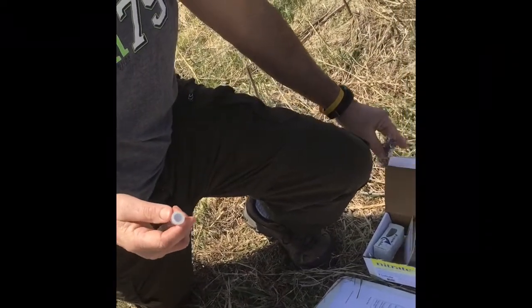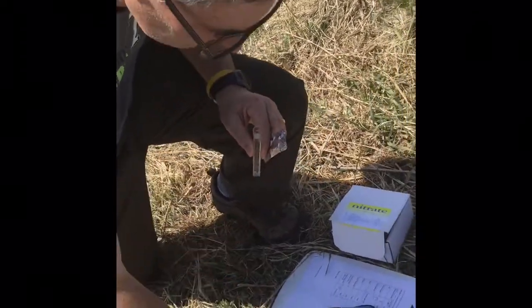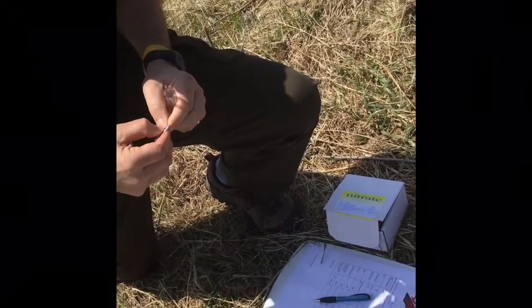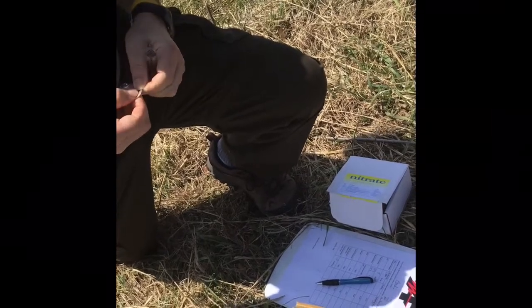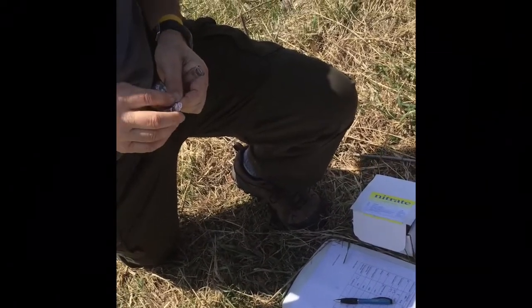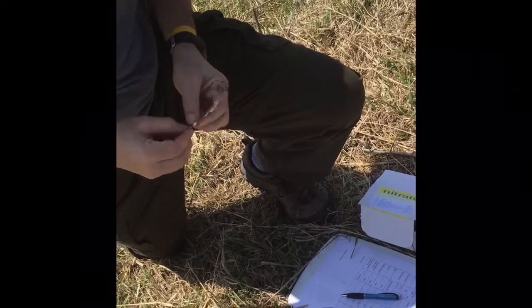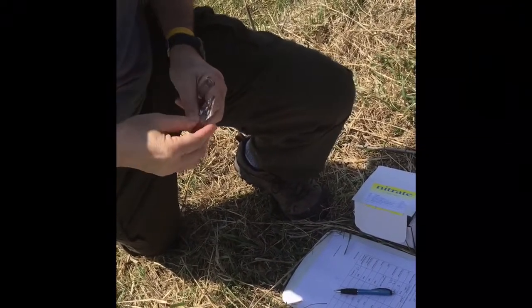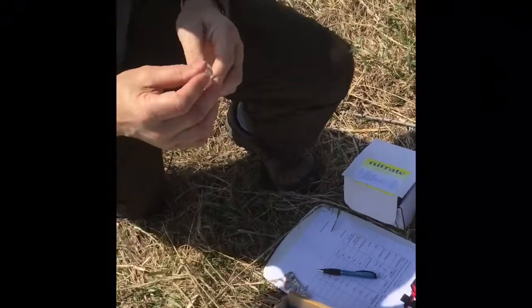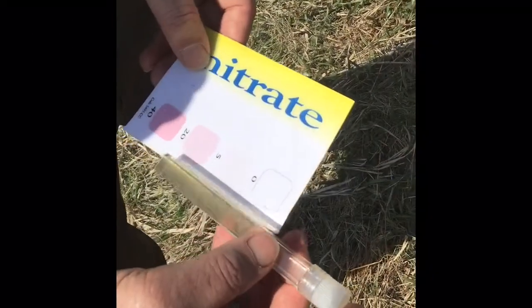The last test we're going to do, at least on the site, is a nitrate test. And this involves 2 tablets. One is a nitrate test tablet number 1, which is this one. Where'd it go? Let's try this. So we'll let this dissolve, and then we'll add another one, and then we'll wait 5 minutes and check the color, and then we should be done with the nitrate test.